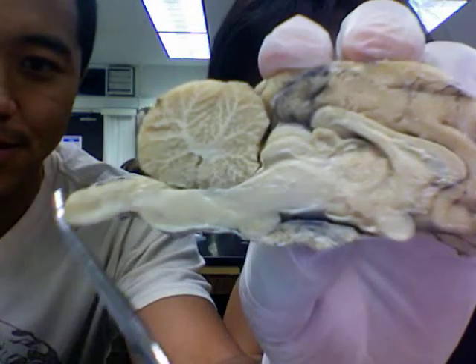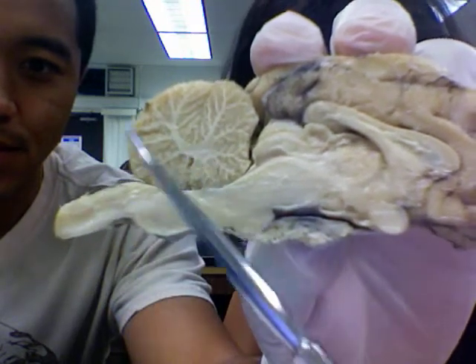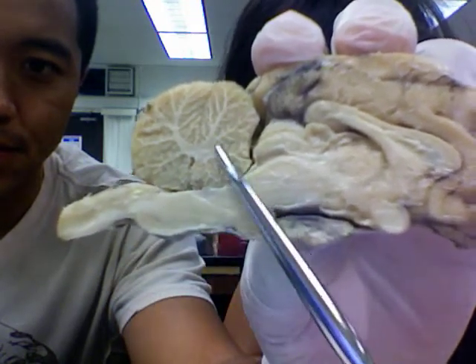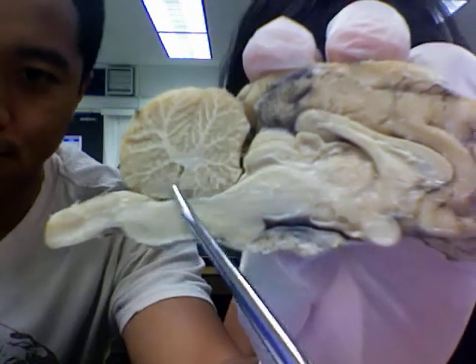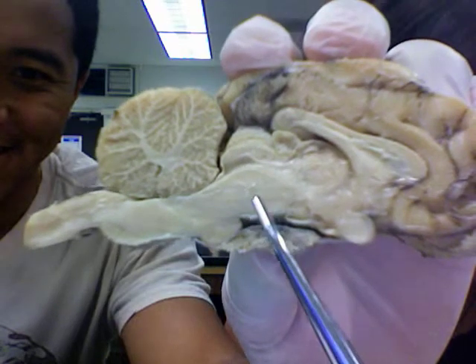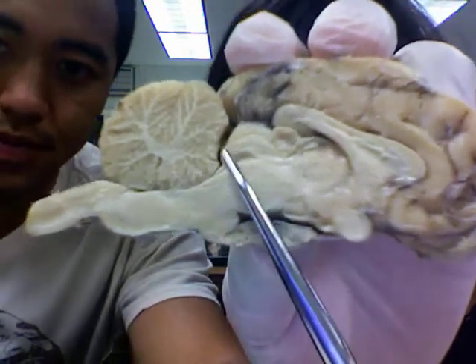Okay so number one — this is a spinal cord? No, this is a cerebellum. And the tree-like thing is the arbor vitae.